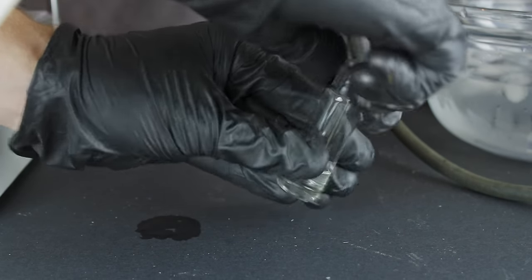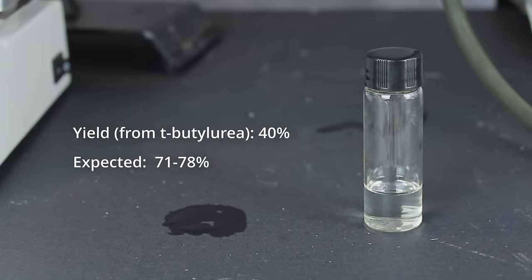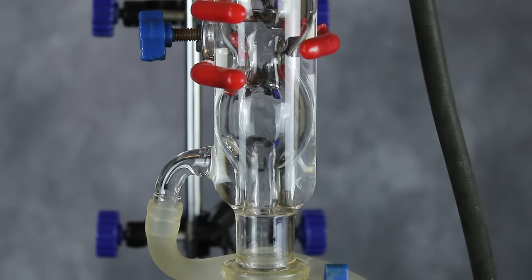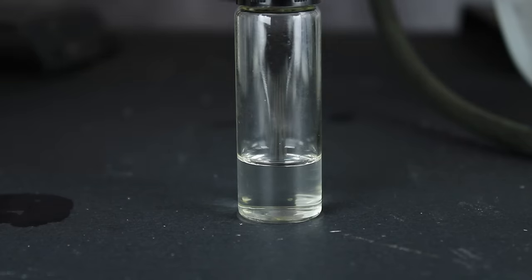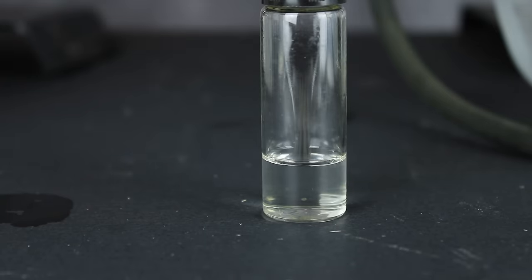Assuming most of the sample was tert-butylamine, my yield with respect to tert-butyl urea was no more than 40%, where it should have been closer to 75%. Honestly, if I had carried out the reflux for the full 4 hours with a more efficient condenser, I might have doubled my yield. But what's done is done, and I'm overall quite happy to have successfully shown one of the few ways to get tert-butylamine at home.